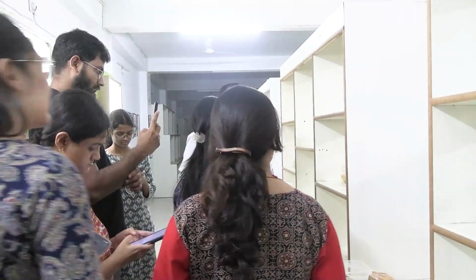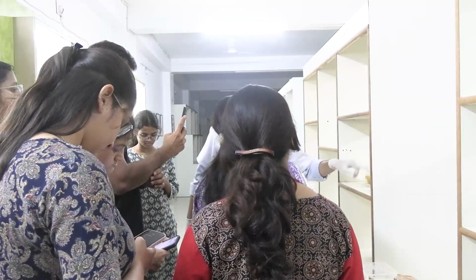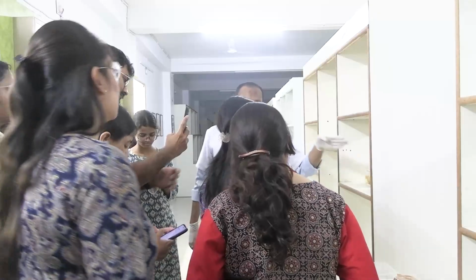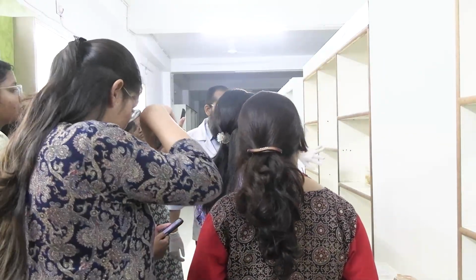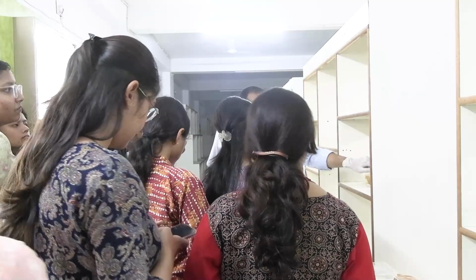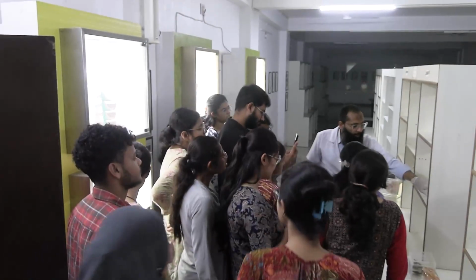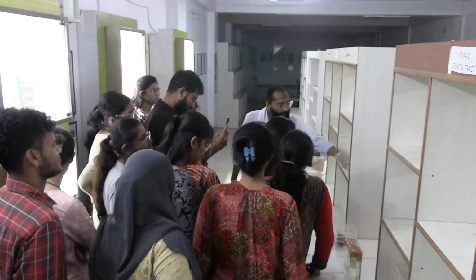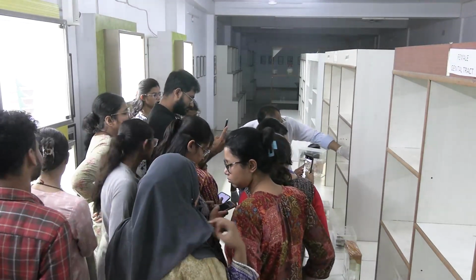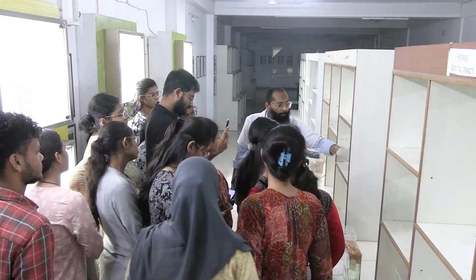So now this is confirmed that this is the breast, because you can see the skin and there is a nipple. Since the sections were taken, it has got distorted. But I can see here this was a nipple, there is a tumor, and the sections are taken from the tumor. The whitish area which you can see, that is a tumor. This whole part from here up to here is part of the tumor.